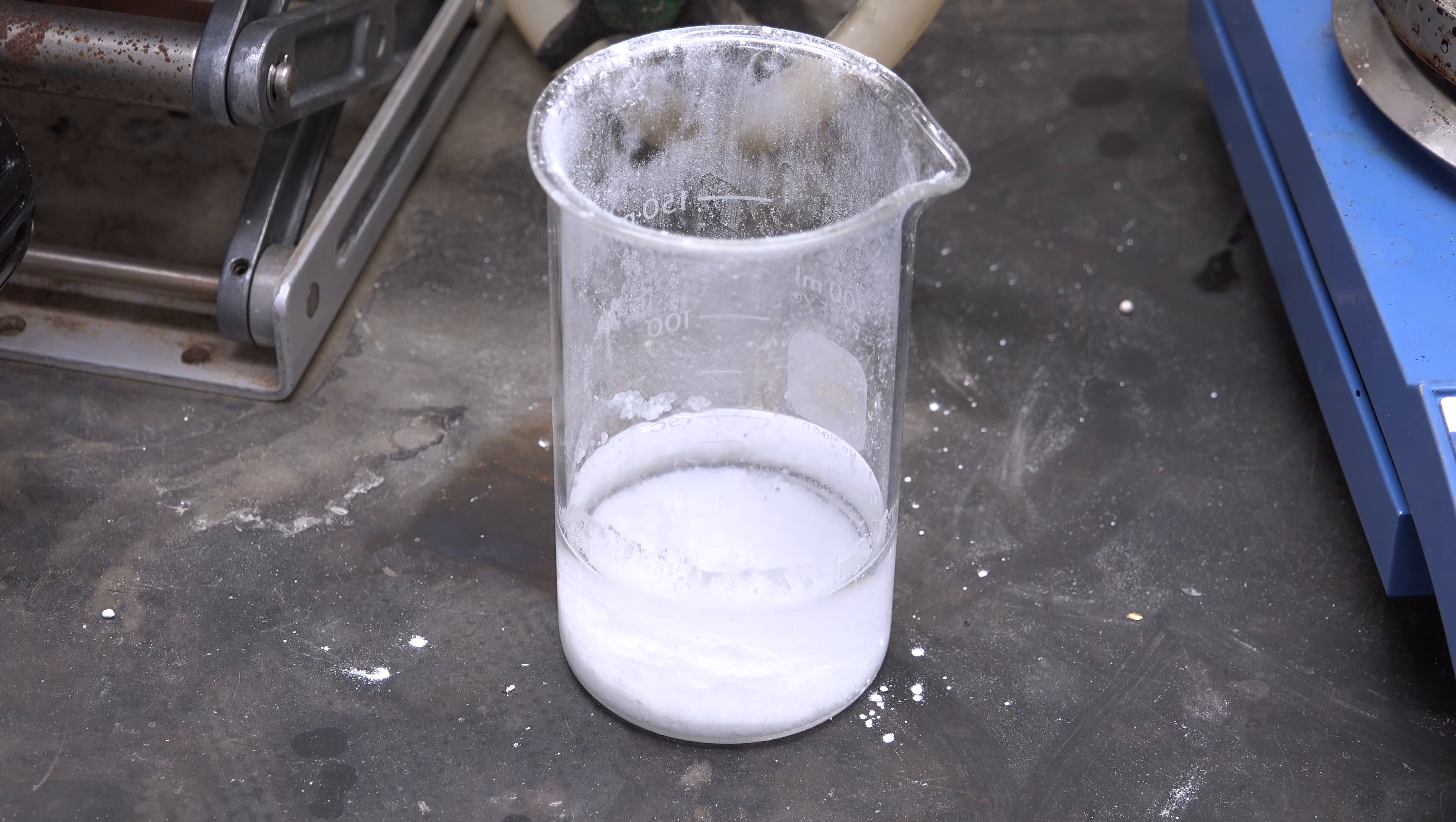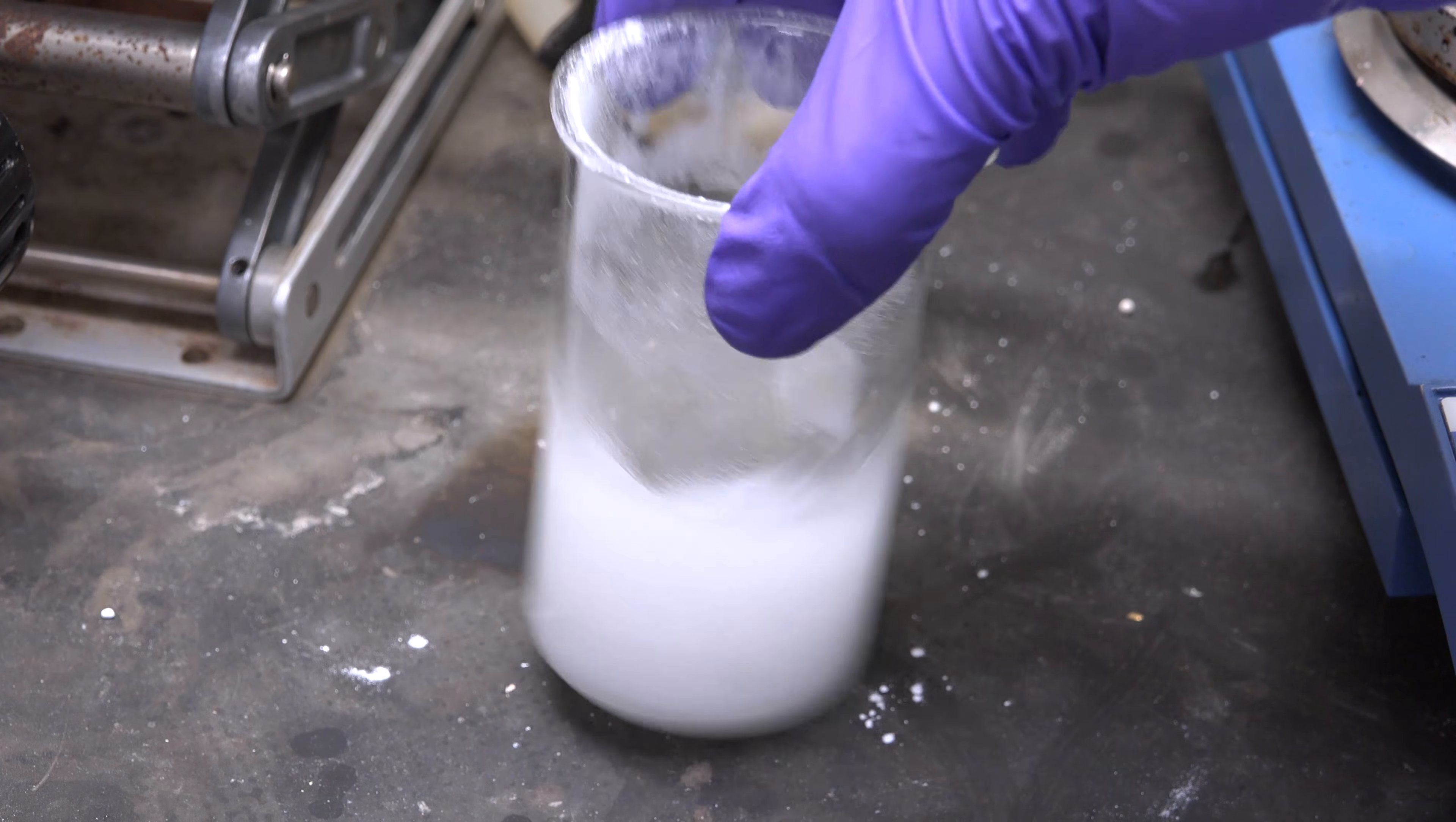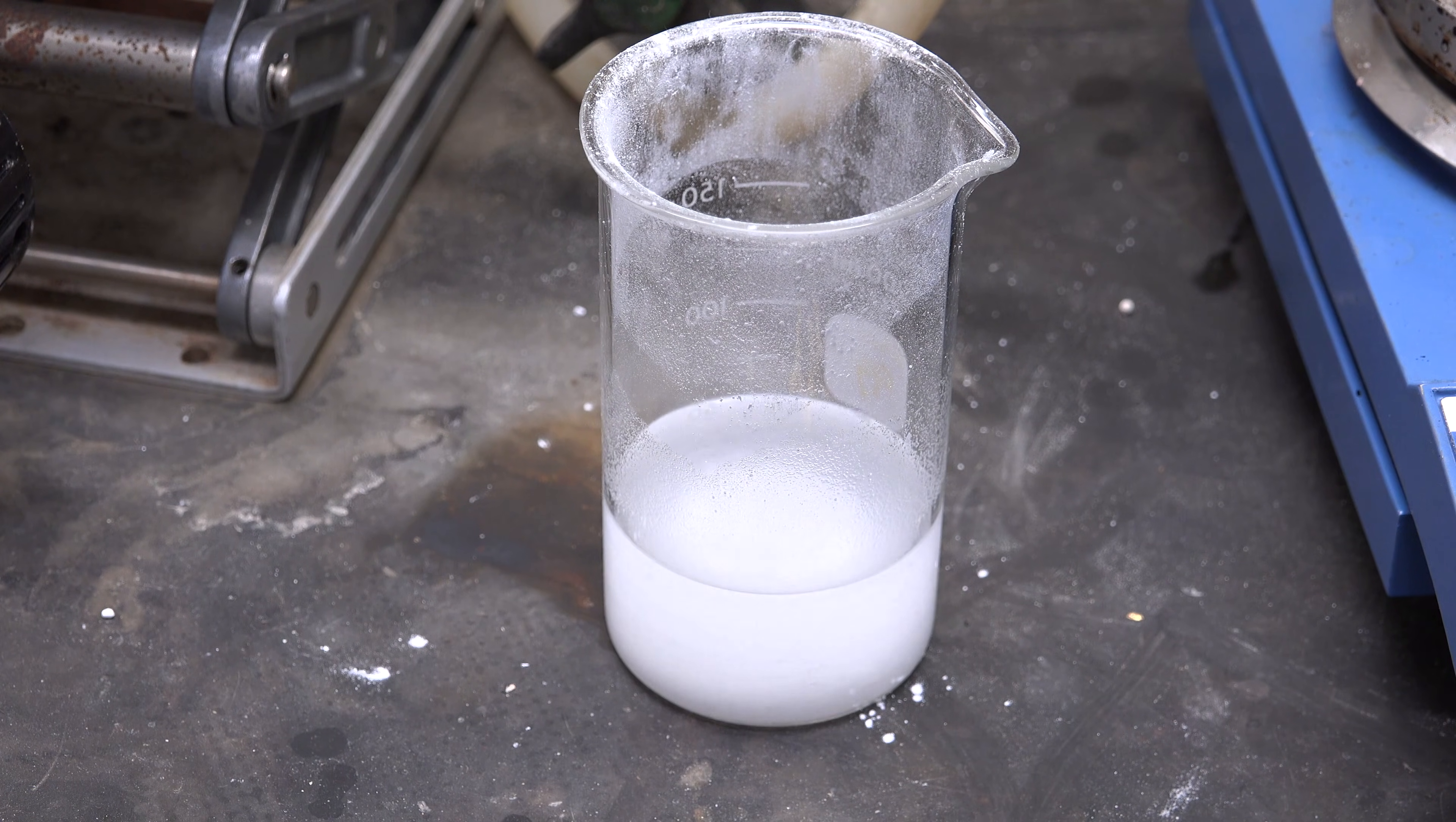Anyway, my total yield was 160g or about 50%. While this is bad, it's not representative of this reaction in general. Other amateur chemists have easily gotten 90% or better yield using the exact same procedure. I think I simply didn't heat it long enough or high enough and I likely lost a lot due to evaporation. Anyway, I'll be using my bromoethane for making Grignard reagents.